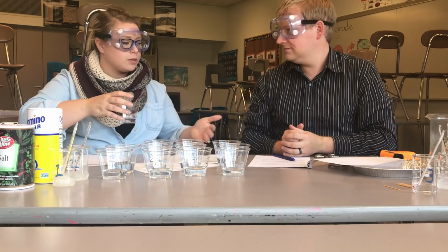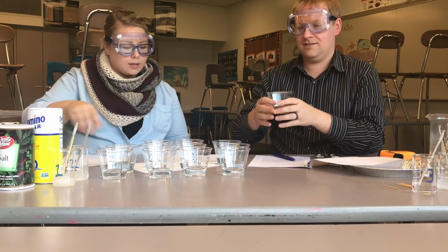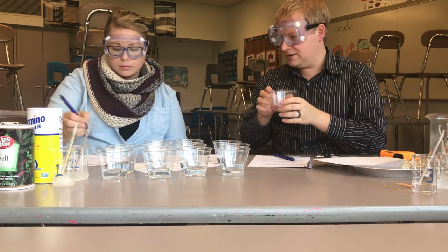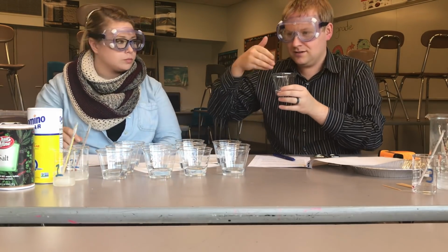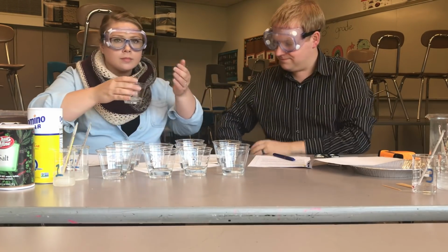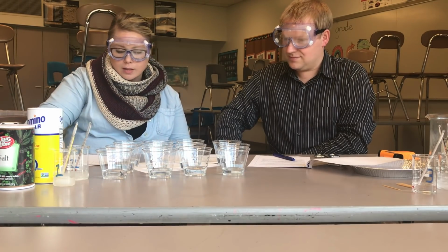Number 1, I'm not smelling, doesn't seem to have an odor. No, I'm not getting any odor either. Okay, so I'm going to say no odor. Number 2, I'll check this one. I'm getting a little bit of something. A slight odor for number 2, so we'll write that yes, it does have an odor.